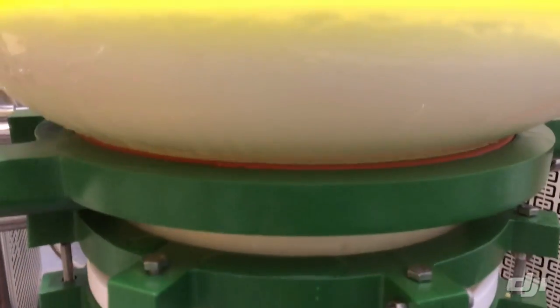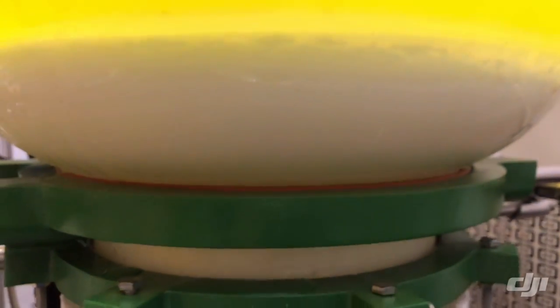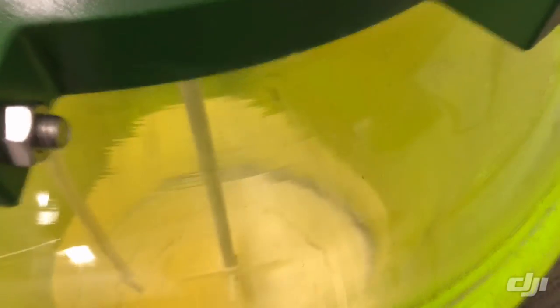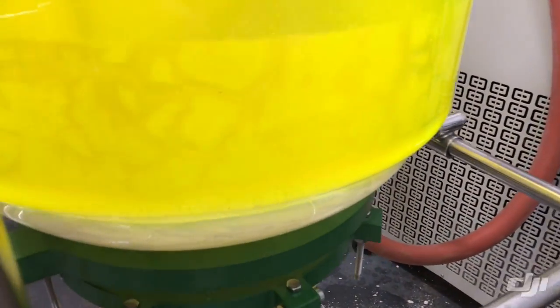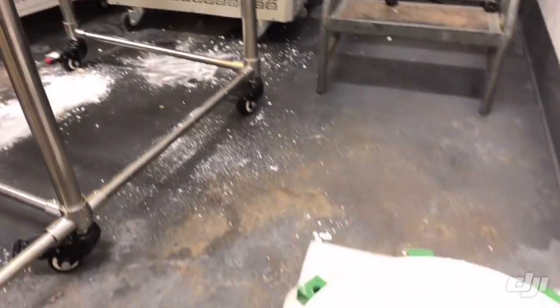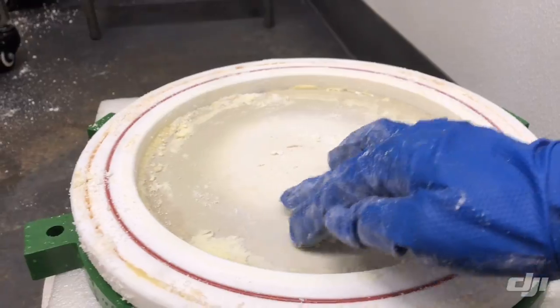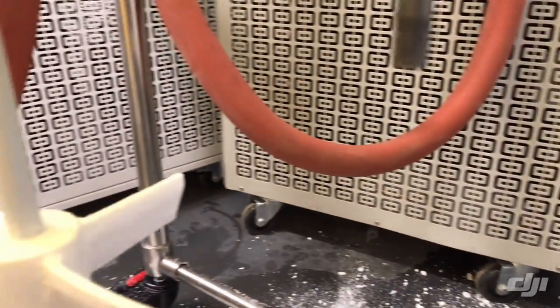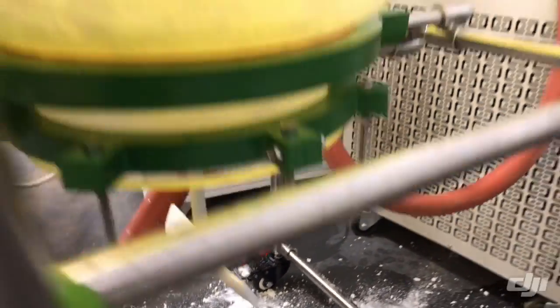Let's go to the top and take a look at the isolates. Right here we have the pure white isolates. What we can do is add more pentane into the system and wash it. In this case, the isolates came out pretty clean, but you can wash one, two, or three times depending on actual needs. We washed one time. After washing, we remove the plates — this is what we call a filter plate. It feels solid, but it's not — the pores on the plate are actually very small.